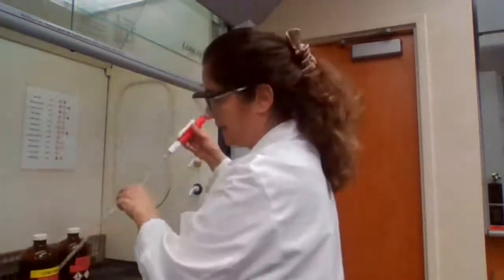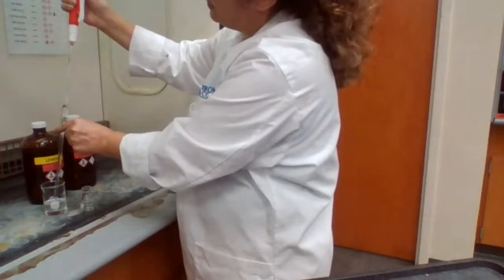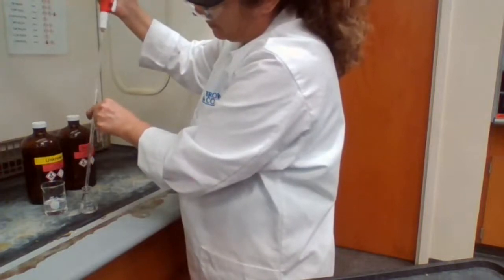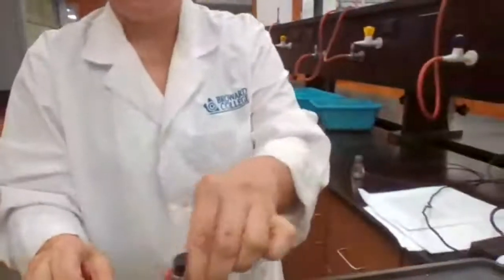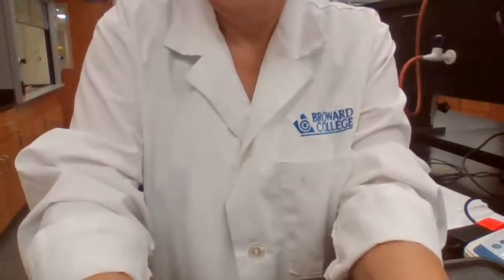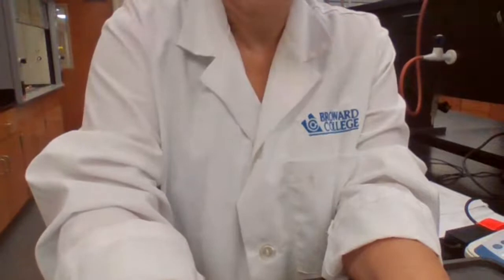And the two liquids, they look both clear like water, but they're not the same. You might see that they have different density. 10 milliliter of one liquid doesn't weigh as 10 milliliter of the other liquid. Okay. Going to measure the mass plus liquid equals 42.656 grams.